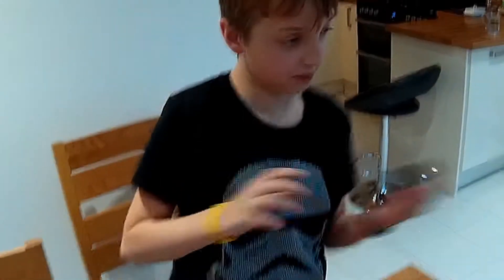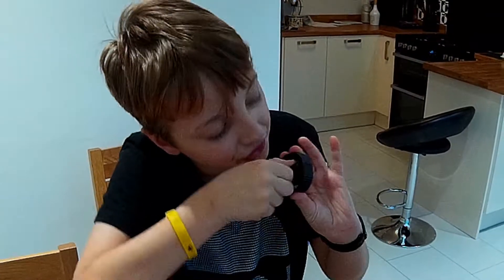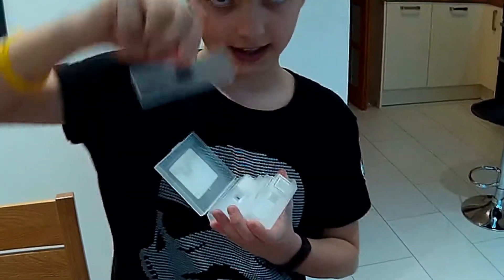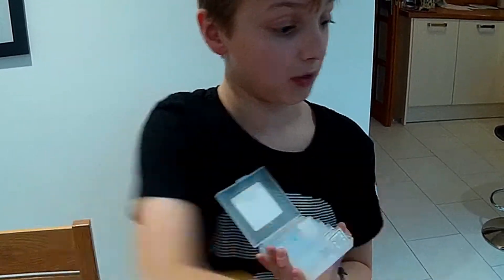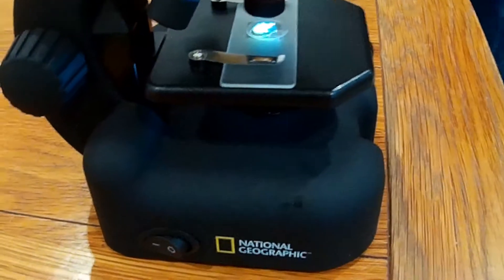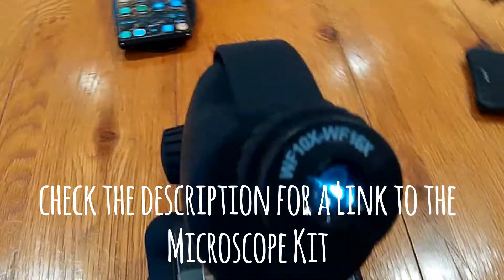If you want a piece of leaf but it's too big, just put it in the little slot. You need thin slices. Why do you need thin slices? You need to be able to fit it on the slides, which you put your specimen on. It needs to be thin so the light can pass through — there's the light switch. The light passes through the slide, through the material you're looking at, down the lens, and into your eye.